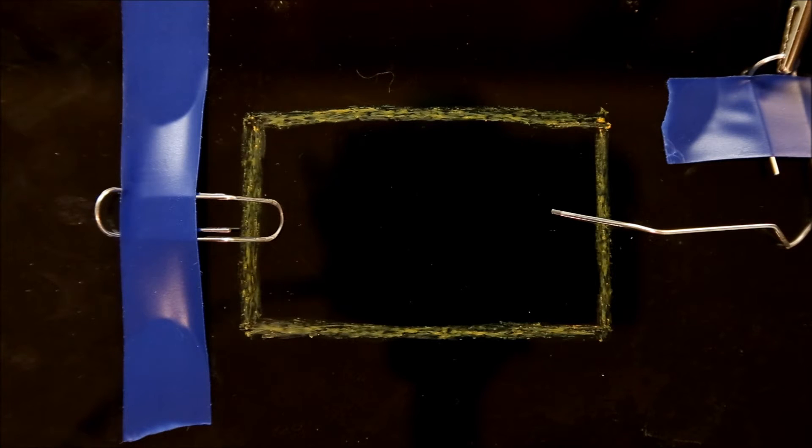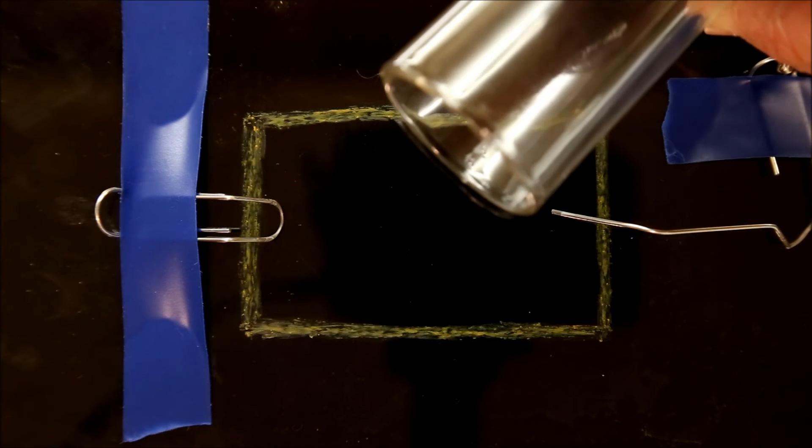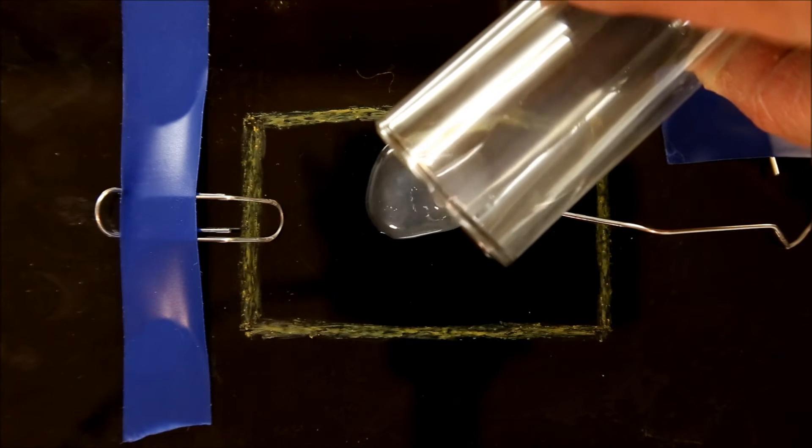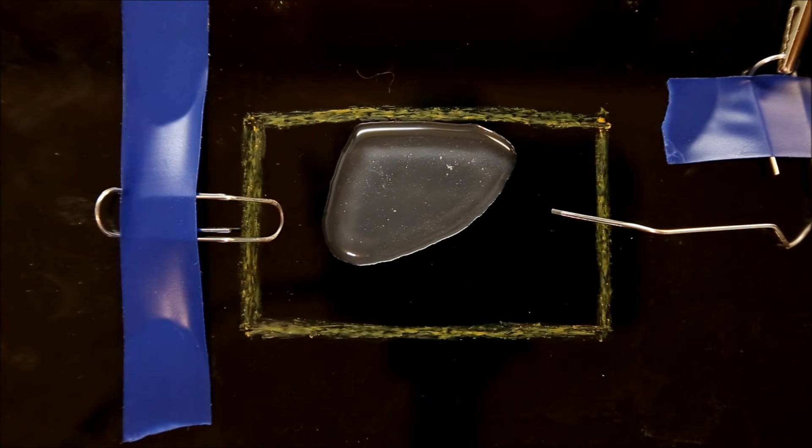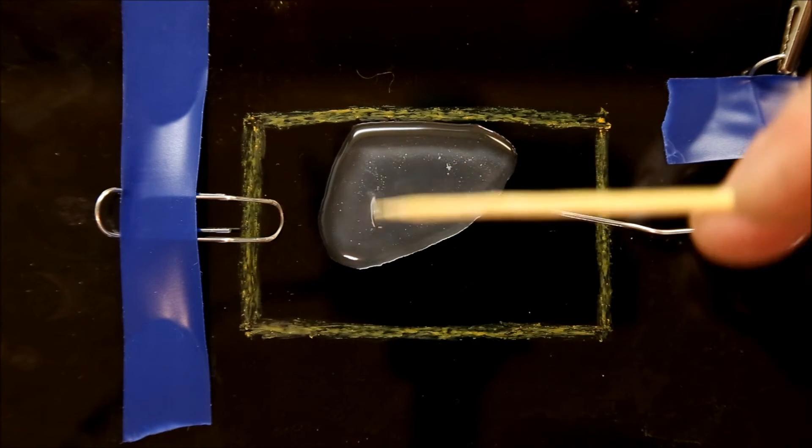Once everything's all set up and the solution is ready, pour it into the center and then use a stick to spread it around.